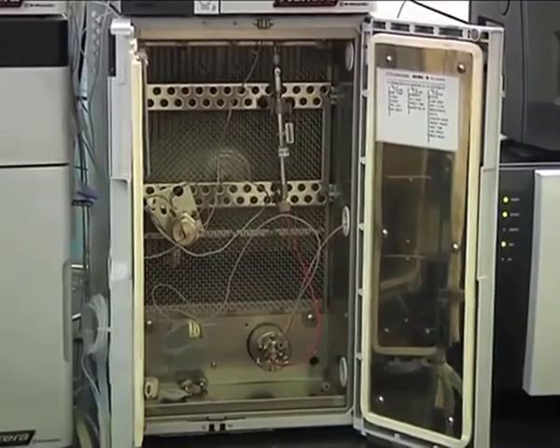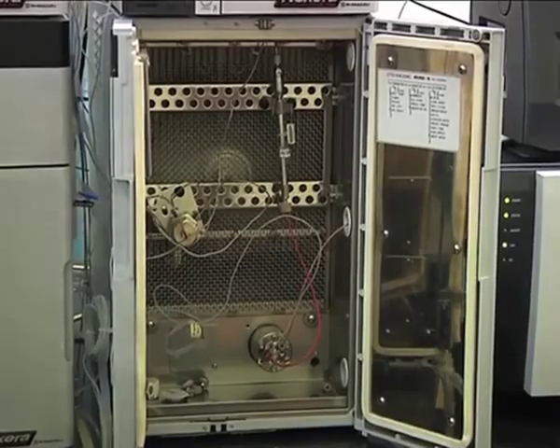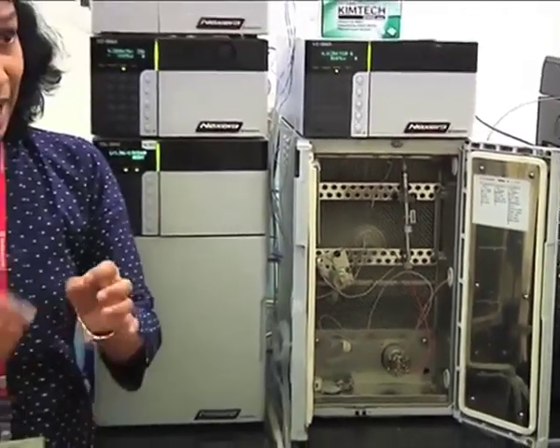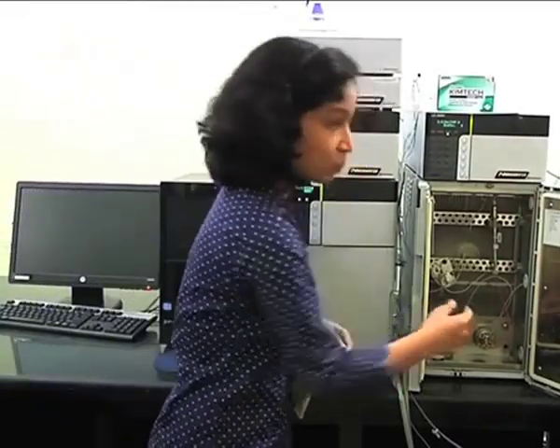Generally I told you this is a fast HPLC system. So the fast HPLC system's main use is reduction in the analysis time. If my analysis time is only 5 minutes or 10 minutes, and in that I want to do gradient analysis, that means my A to B concentration is continuously changing, my mixer should be so efficient that within that smaller amount of time it should give me proper mixing. So this mixer is specifically designed with microreactor technology, so its mixing efficiency and mixing accuracy from run to run is very good.